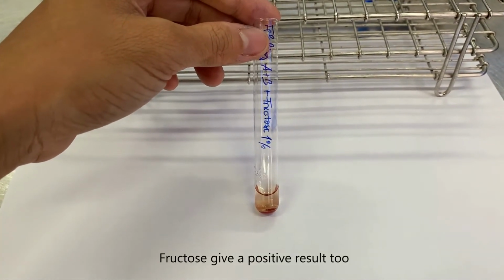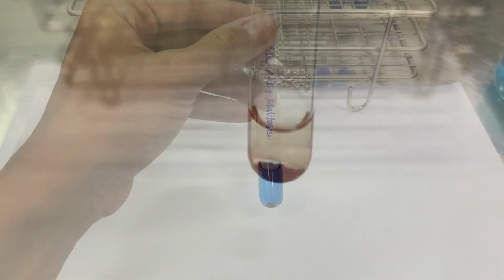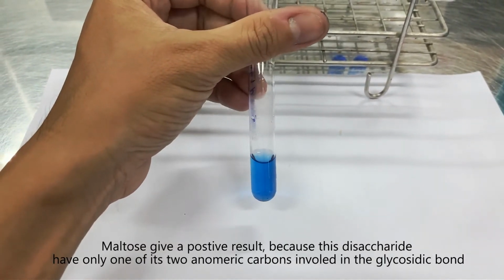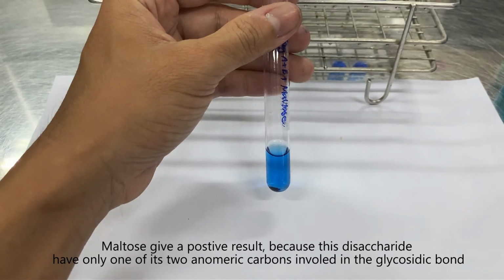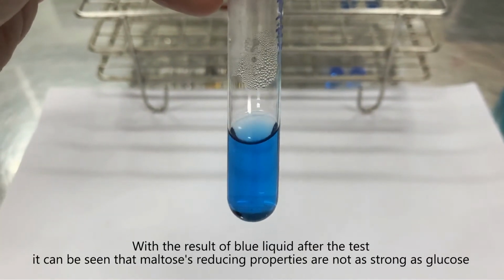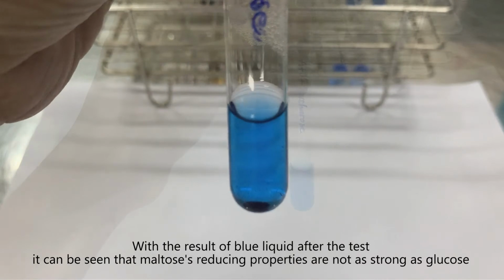Fructose gives a positive result too, because it can reduce copper(II) ion to copper(I) ion. Maltose gives a positive result, because this disaccharide has only one of its 2 anomeric carbons involved in a glycosidic bond, meaning that it can convert to an open chain form with an aldehyde group. With the result of blue liquid after the test, it can be seen that maltose's reducing properties are not as strong as glucose.